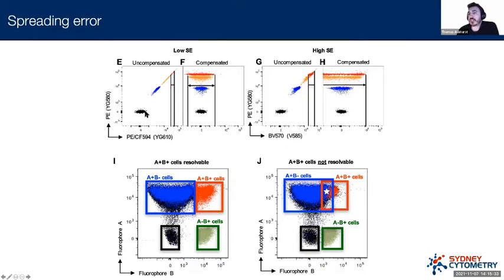The way this shows up in flow cytometry data is if we have a look at this left panel in E here, we have PE and PE-CF594, just like before. If we look at the uncompensated data, we can see that as the signal is getting brighter, and remember this is on a bi-exponential scale, so all of this section here is in log, as this signal is getting brighter and brighter, there's actually a bit of width to this. It's a bit hard to really appreciate at a low level, but for every measurement, there's a little bit of wiggle room on the x-axis.